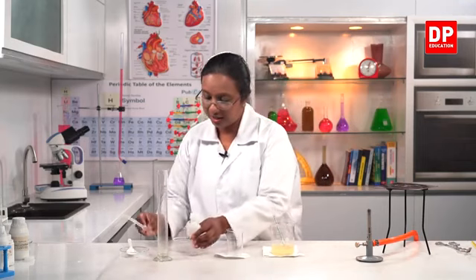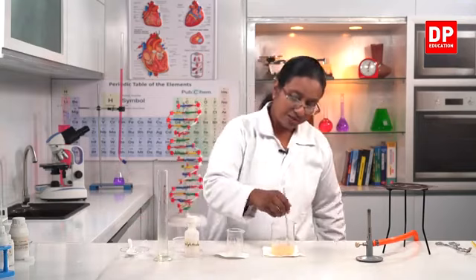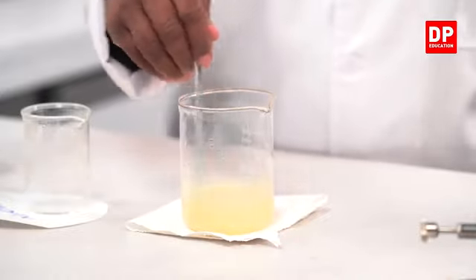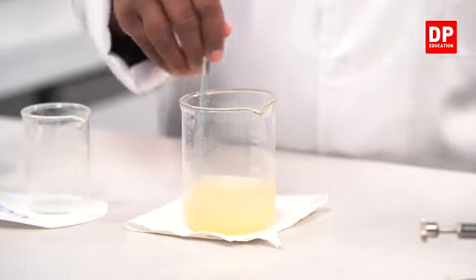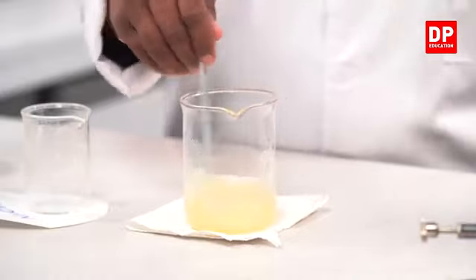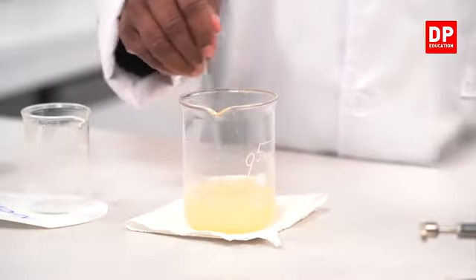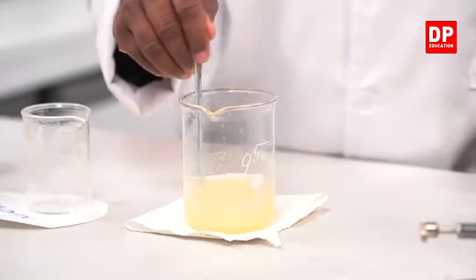So that is to indicate it's the base, and also when we mix it together, the soap will become pink in color. Now the base is reacting, that is why the color disappeared. So after some time, if I add it again, we will get the basic color. You can see then before, now the mixture is becoming paste-like, more thick.